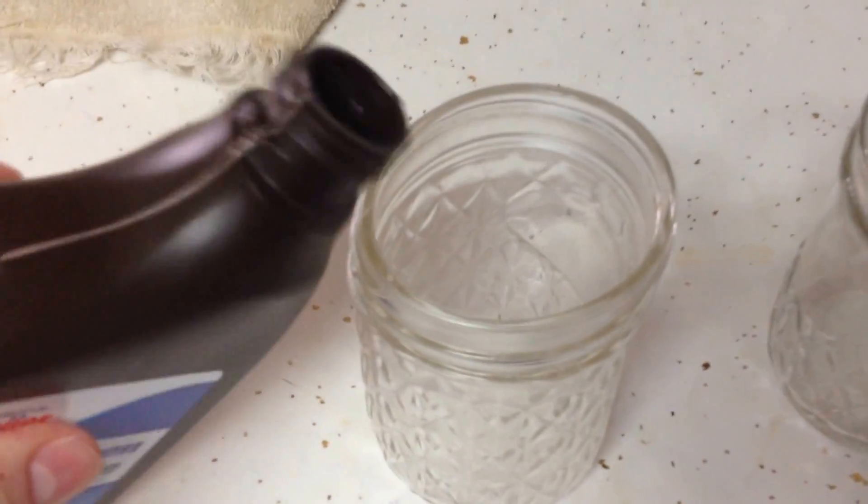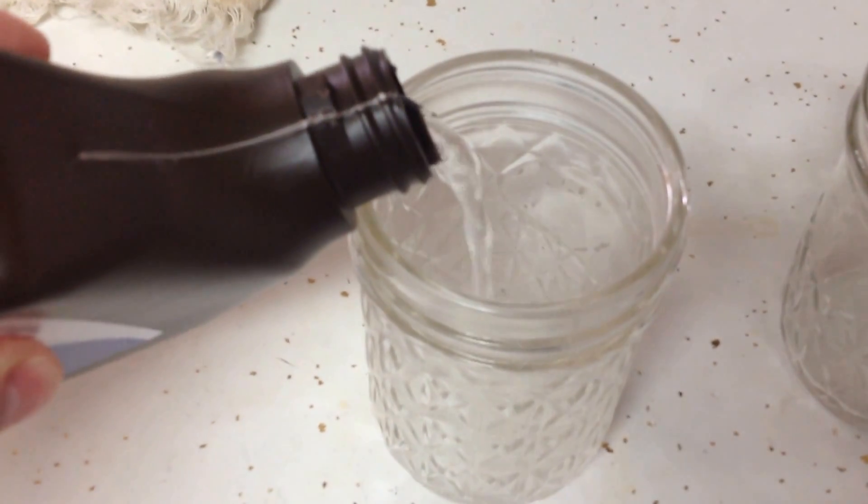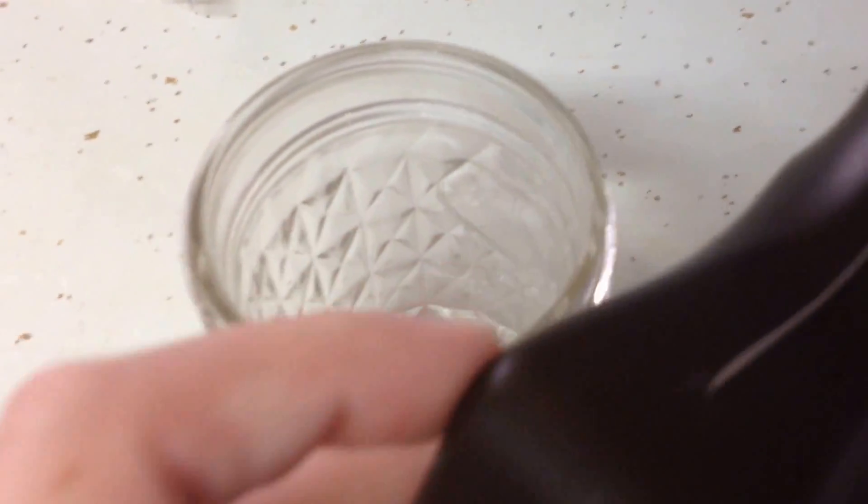So I'm going to pour some hydrogen peroxide into each of my containers. Don't need a lot. So there's hydrogen peroxide at the bottom of each one of these.